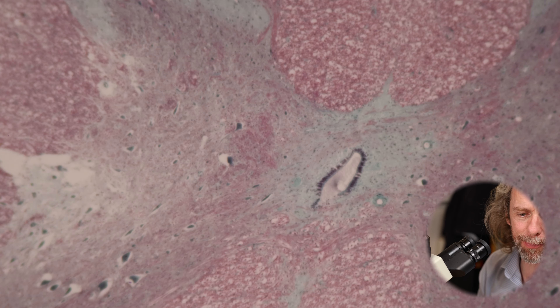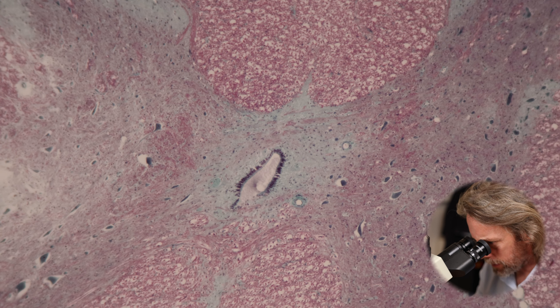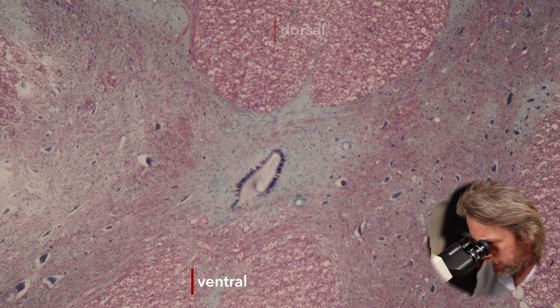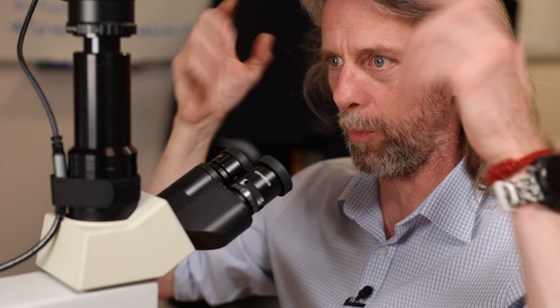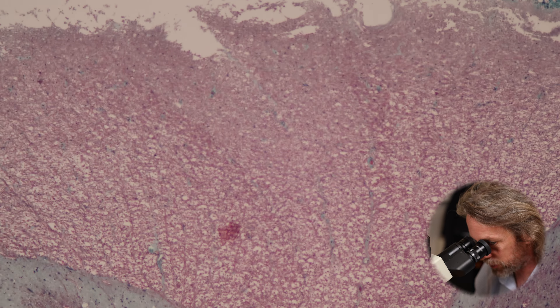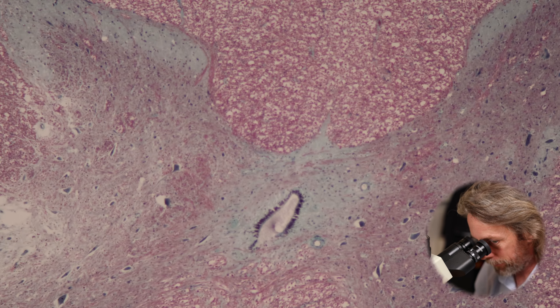When we look at the spinal cord — and the nervous system generally — instead of talking about anterior and posterior, we talk about dorsal and ventral. That's largely because in humans the central nervous system changes angle due to the way our eyes look forward. So dorsal is the back, ventral is the front. On this section, that's the dorsal side — I can tell from the gray matter — and this is the ventral side. Look at the size of the neurons in there — they're enormous!